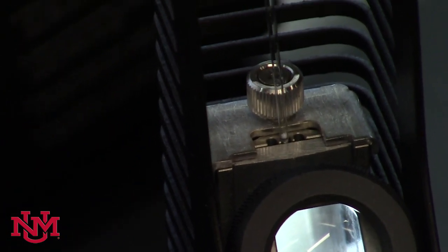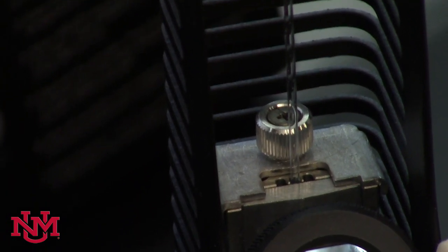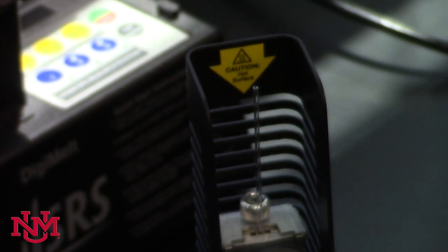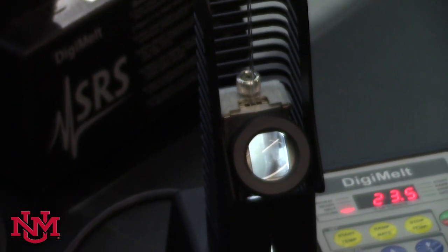Either one of the three slots will work. You can see we have a magnifying glass. That's going to allow you to view the sample, and you're looking for two temperatures.